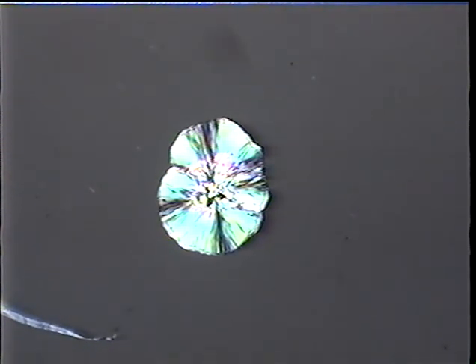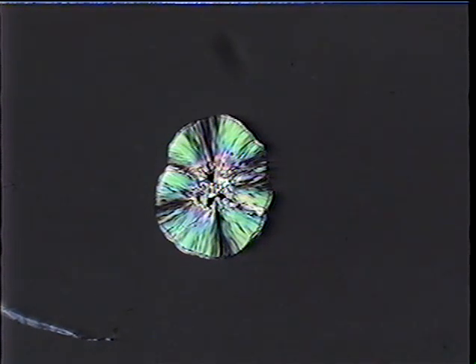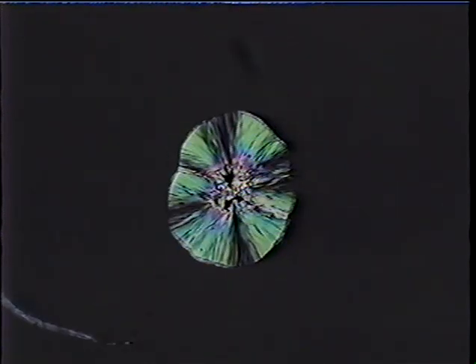DDT grows very slowly, especially at room temperature. It would take a number of hours actually for this whole preparation to crystallize. It starts out growing as a single needle that bifurcates on each end and thickens on those ends, producing something that looks a little bit like a bow tie. There's a little one there. These bow ties then gradually get bigger and broaden and form the spherulites that we see.